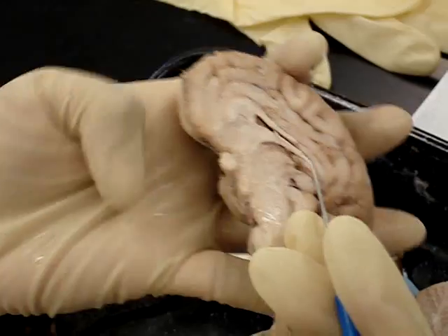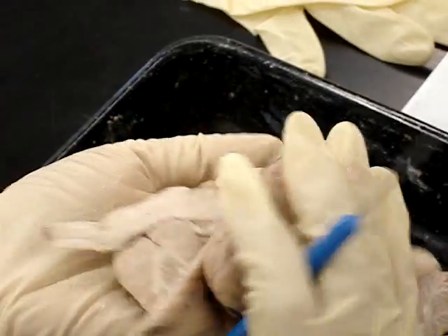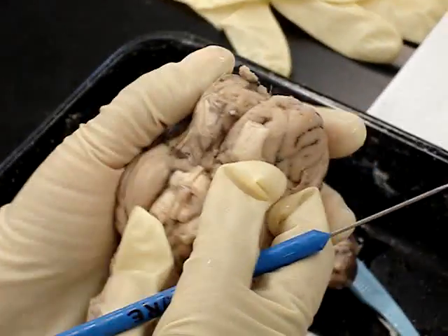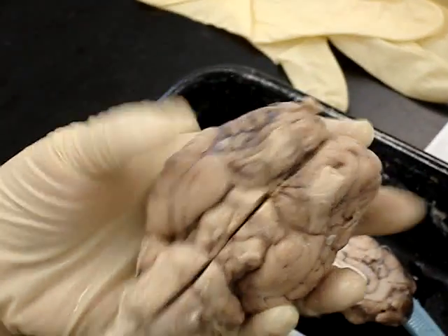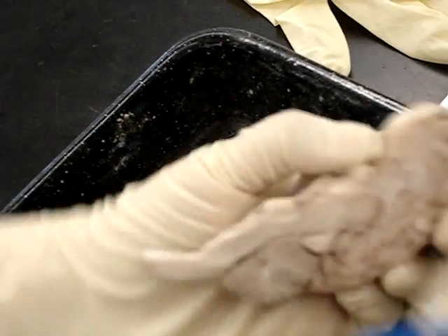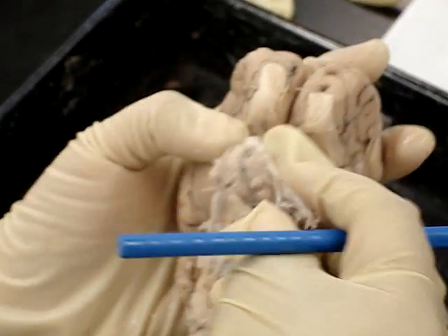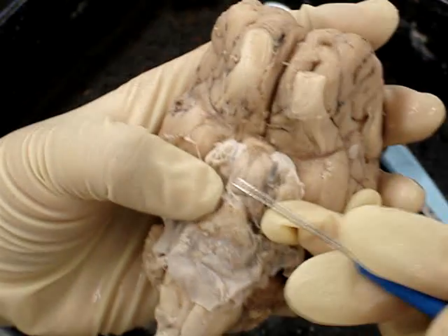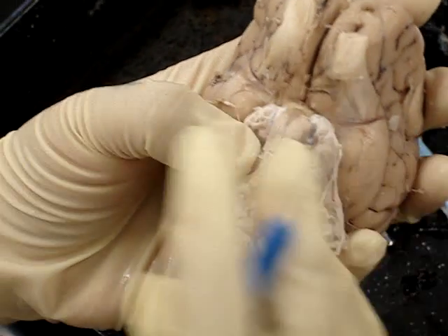The pituitary gland. It gets cut off here. This is the dura mater — it's this bump right here. This big thing here — that's the pituitary. The dura mater and pituitary gland are visible in this section.